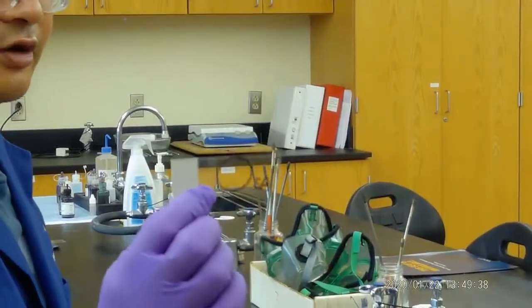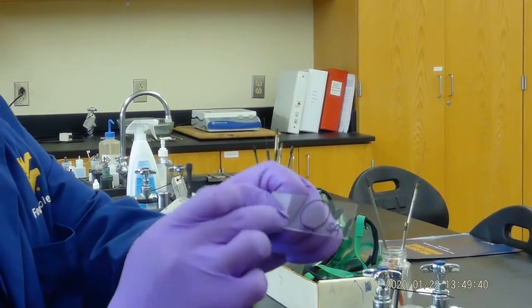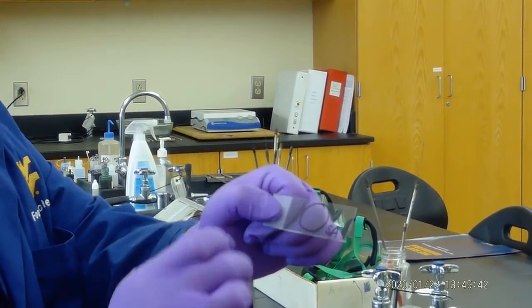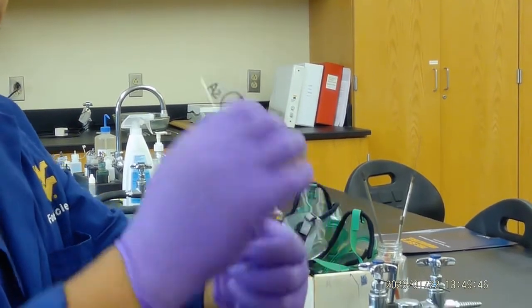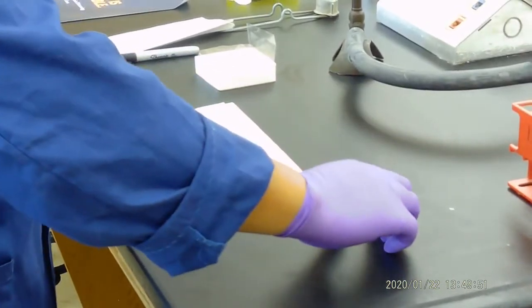But be careful, because these dye or markers may damage the lens of the microscope. So you have to flip it over. We use the other side to do this.